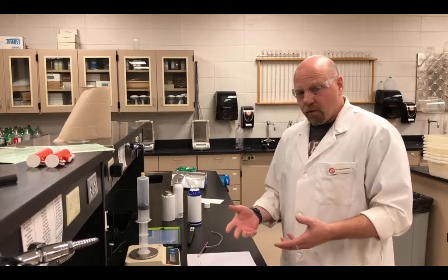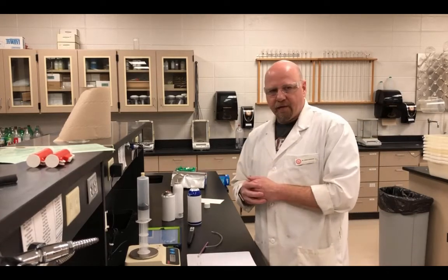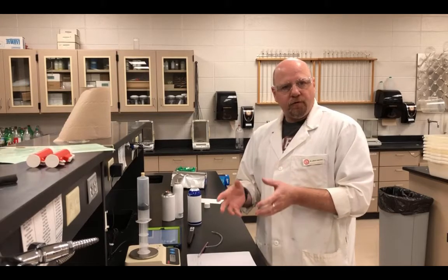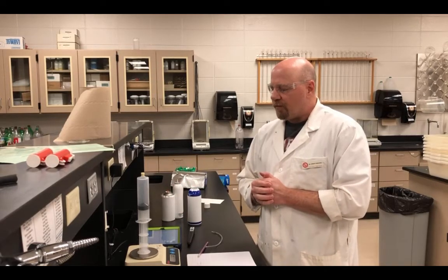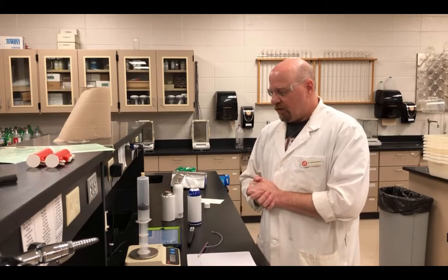I will end up doing a total of 6 trials, because I'm going to do 2 trials for each one of the gases. Now, you'll have the data shared with you for you to do the calculations for all 3, but I'm just going to do one more trial for this, so you can see again what the procedures and steps were.